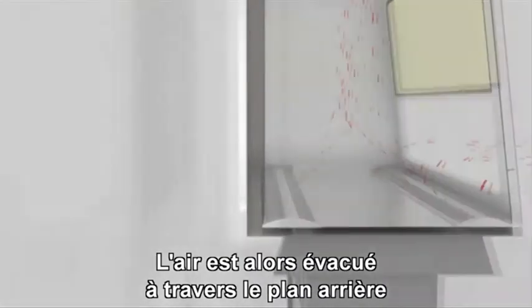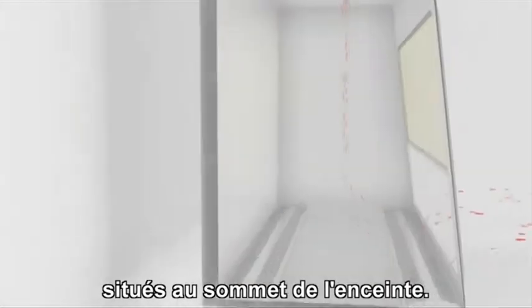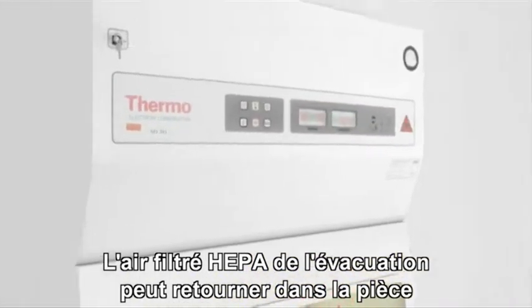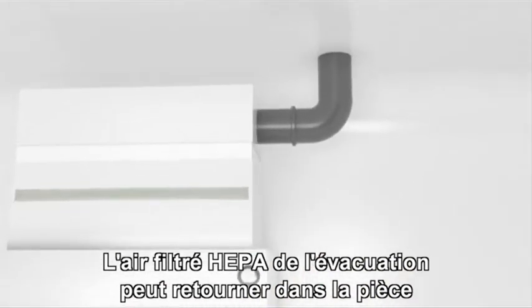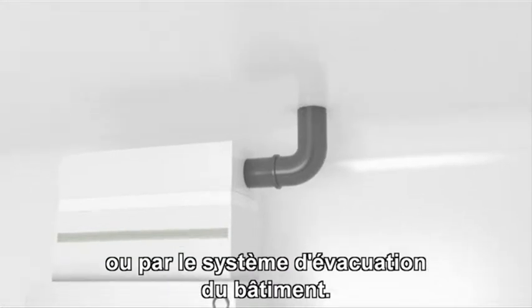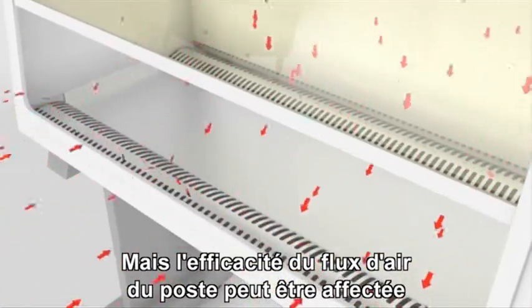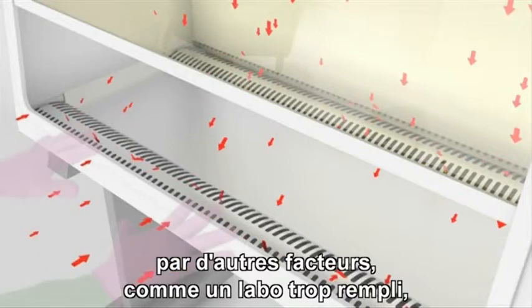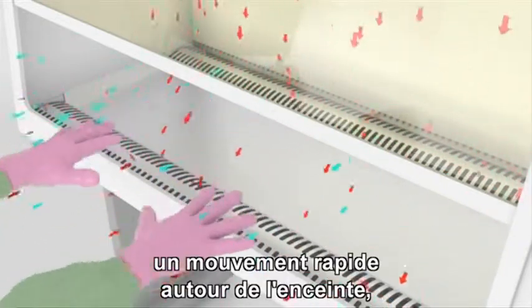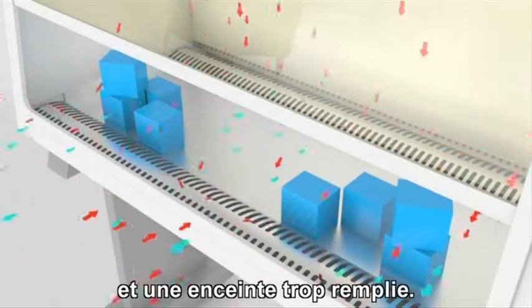The air is then discharged through the rear plenum into the space between the supply and exhaust filters located at the top of the cabinet. HEPA-filtered air from the exhaust can be recirculated to the room or discharged to the outside of the building through a dedicated duct or through the building exhaust system. But the efficiency of the cabinet airflow can be compromised by other factors such as overcrowding in the lab, rapid movement around the cabinet, open doors and windows, and overcrowding in the cabinet.